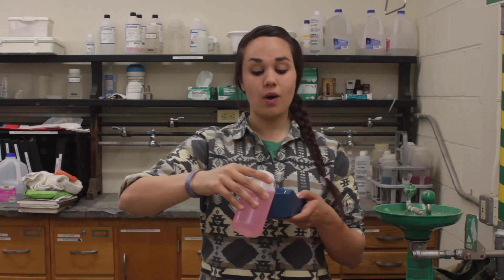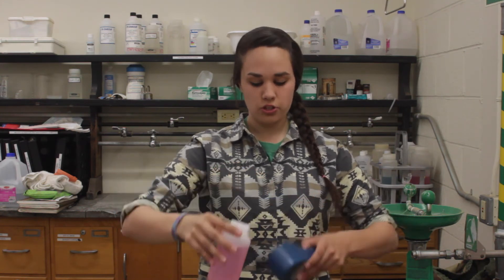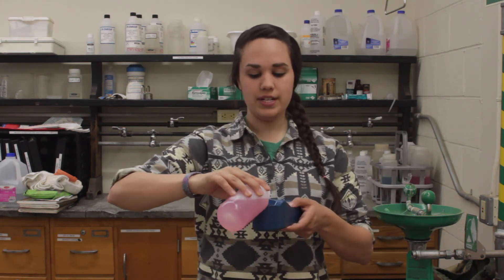So I'm going to empty that neutral solution from my meter, and I can begin with either the acidic or basic solutions. I'm going to start with the acidic solution, so I need to triple rinse again with that new solution — one, two, three times.